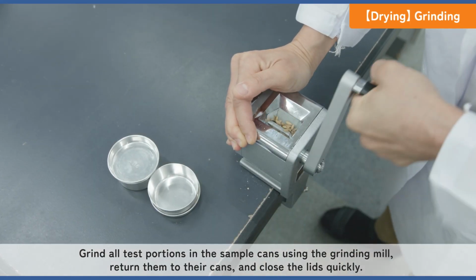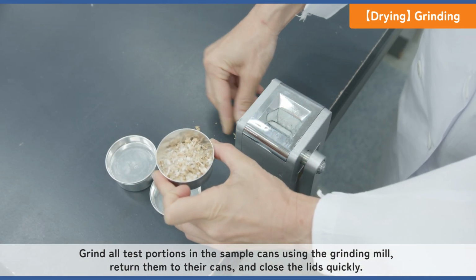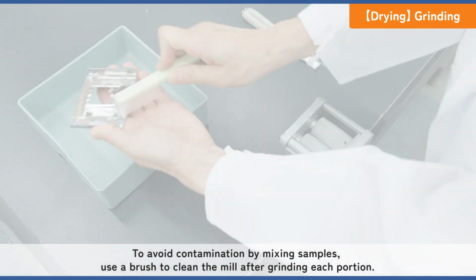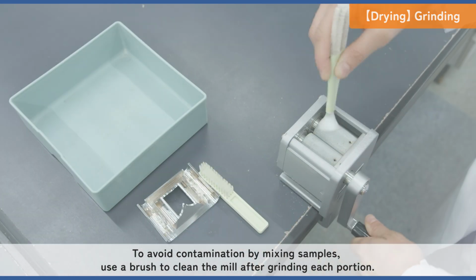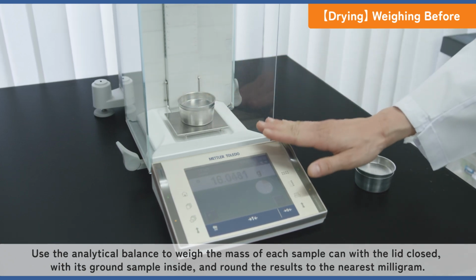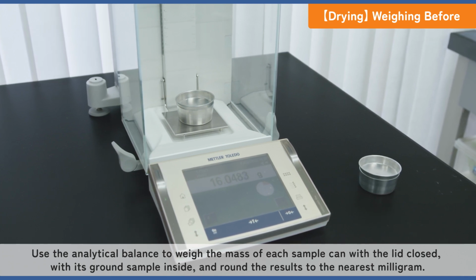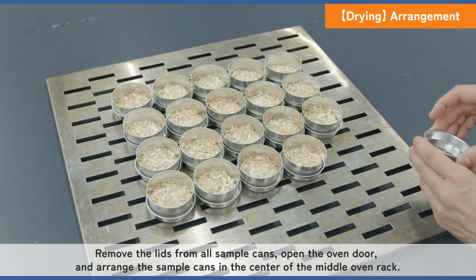Grind all test portions in the sample cans using the grinding mill. Return them to their cans and close the lids quickly. To avoid contamination by mixing samples, use a brush to clean the mill after grinding each portion. Use the analytical balance to weigh the mass of each sample can with the lid closed, with its ground sample inside, and round the results to the nearest milligram. Remove the lids from all sample cans.